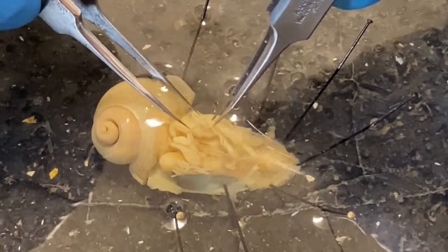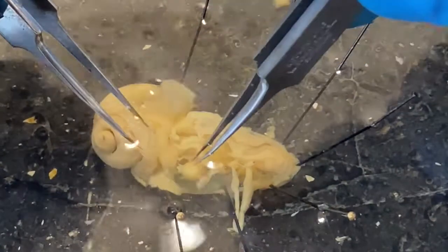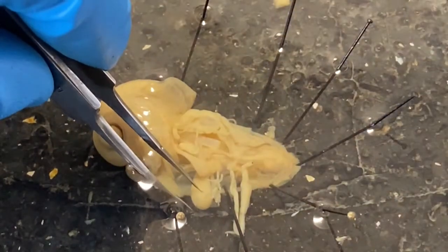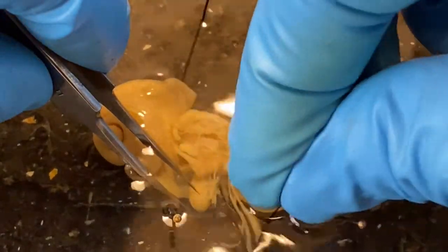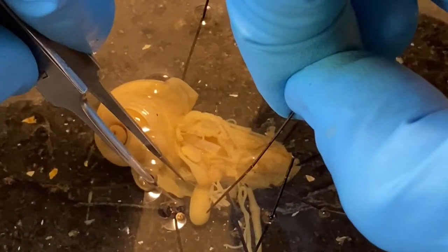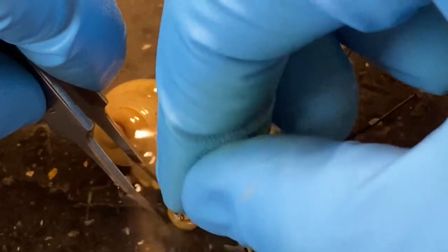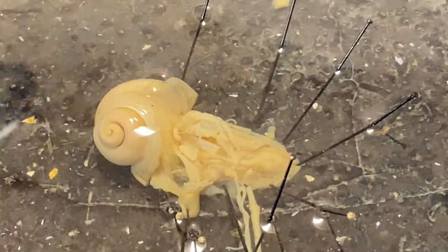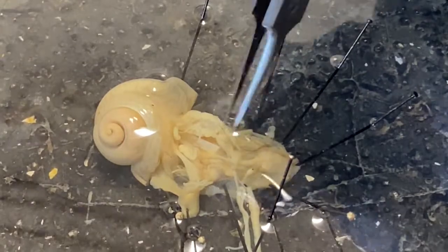I'm going to pull on this and detach the muscle so we can lay the penis out this way, and pull the dart sac out this direction and secure it in place. The dart sac produces darts that are used when snails copulate — they fire these darts into each other, which is apparently a way to stimulate the other participant to release their reproductive material.